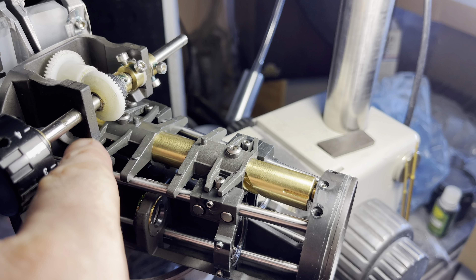With this magnetic attachment, Leica succeeded in creating a nice force that pulls those blocks along the metal rod — no springs needed. However, there is a drawback: due to the strong magnet strength, the force required to rotate the dial is much higher than on Olympus or Nikon scopes. This is technically one of the reasons why those gears are getting cracked.